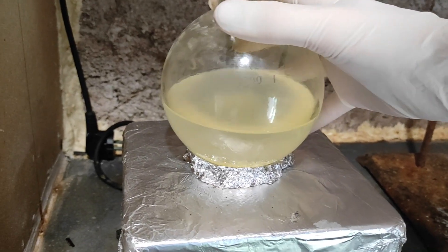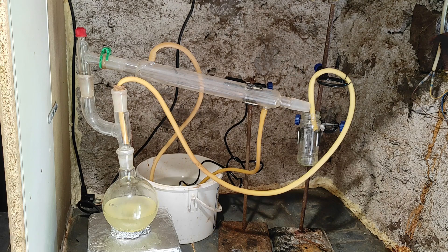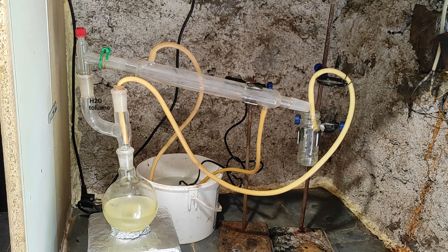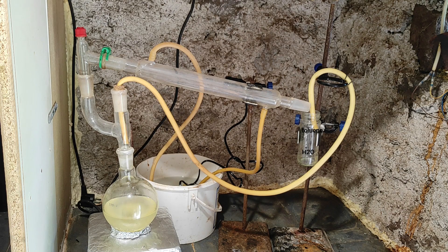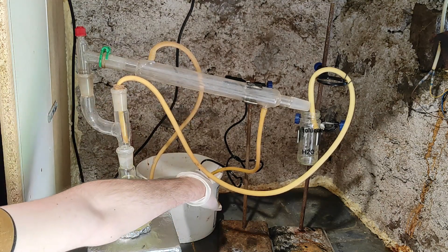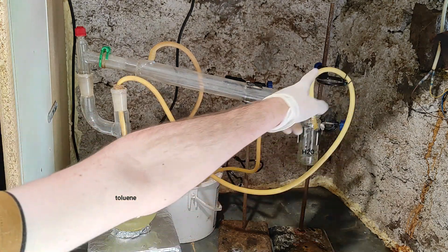As you can see, the mix turns somewhat cloudy and slightly yellow, but that's because the toluene is not pure and the sulfuric acid is reacting with the impurities. Here I mounted a special setup which is supposed to mimic what is called a Dean Stark apparatus. Basically, our reaction will produce water as a side product. This water will boil with the toluene, get condensed, and drip back into the flask. They form two different layers because they're not soluble — like oil and water — and we want to get our toluene back in the reaction flask but not the water. There is a tube connecting back to the reaction flask that acts as a siphon, and if we put it at the right height, we should only collect the toluene, which gets recycled over and over, while the water is removed gradually and gets stuck in the receiver.